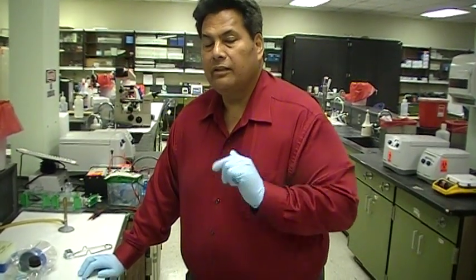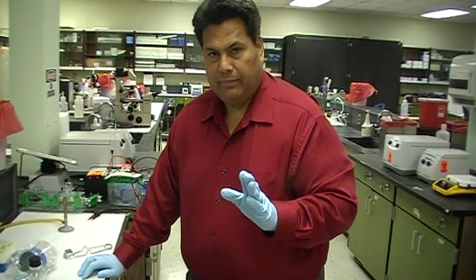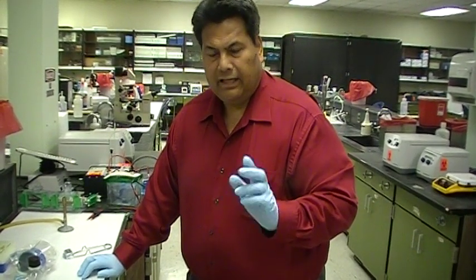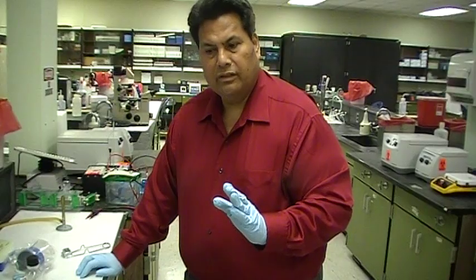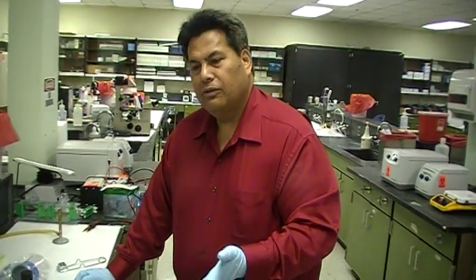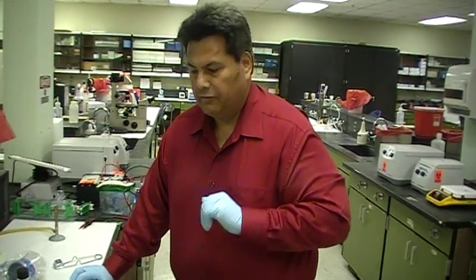But I need to tell you this as well, in the lab, in molecular biology, and really in most science, every solution that you use, with the exception of a few, must be filtered, either for sterilization or right before you use, you need to filter them.